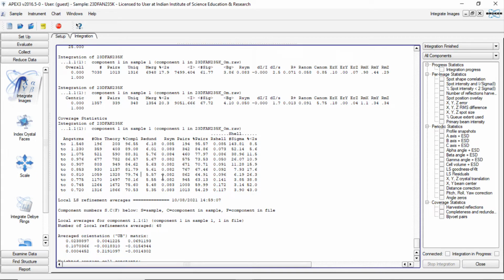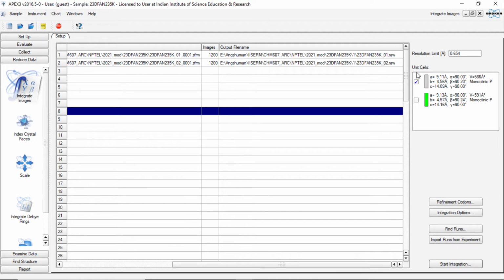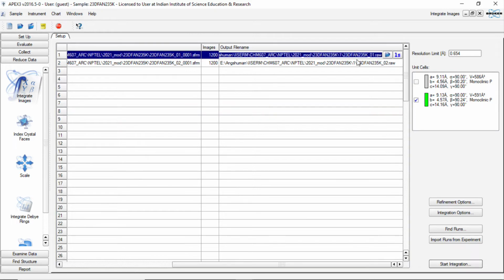So what happens in this case is the number of reflections that were obtained from one set of unit cell, one set of crystal, one particular crystal, is not enough. So we close this. We would do the data reduction once again with the green unit cell and save that data in the folder which we name as 2.